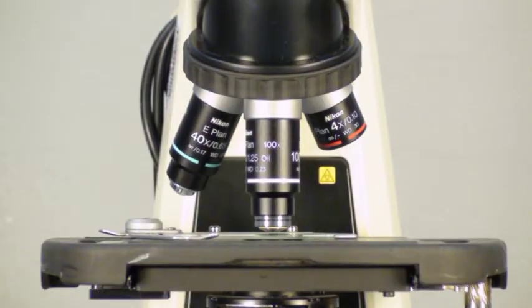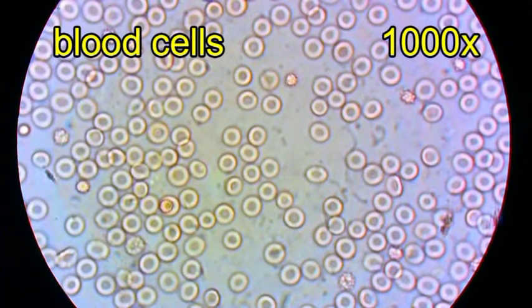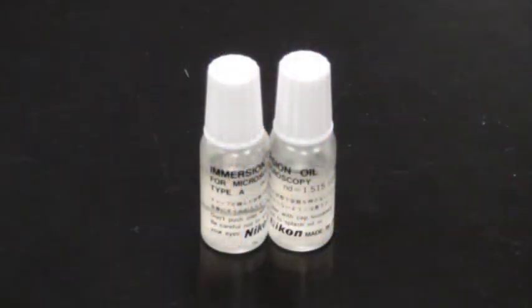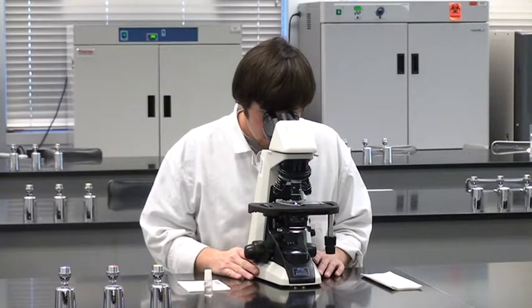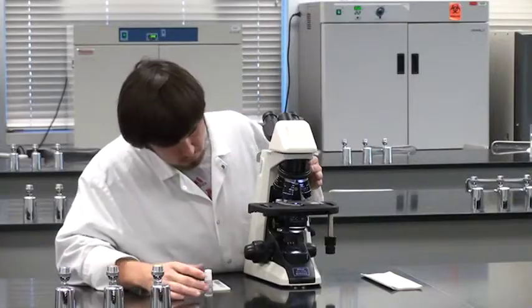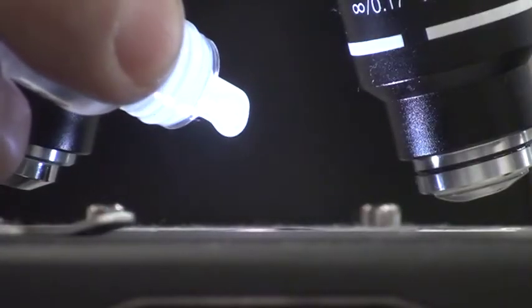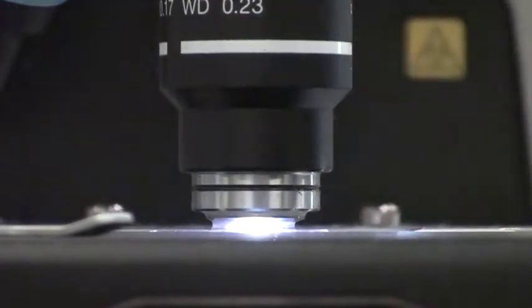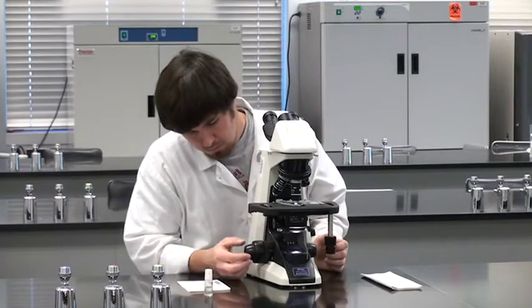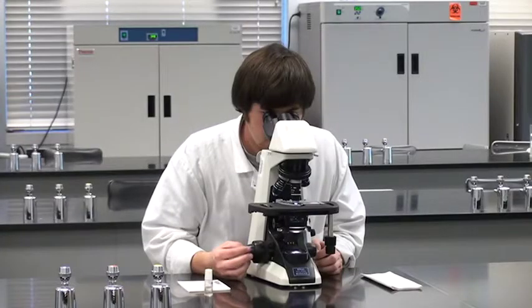The oil immersion objective provides the highest magnification at 1000x and is mainly used to examine extremely small specimens such as a single cell. To view a specimen with it, you must place immersion oil on the slide to see the image. Rotate the nosepiece so the high dry and oil immersion objectives are on either side of the slide. Remove the cap from the oil dropper, position the tip over the slide, and squeeze one drop of oil onto the specimen area. Then rotate the oil immersion objective over the slide. Sharpen the focus and you now have a 1000x image. Remember to use only the fine focus knob with this objective lens.